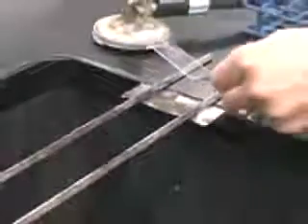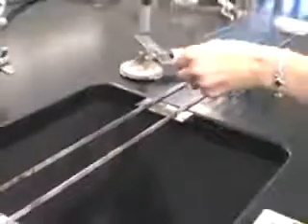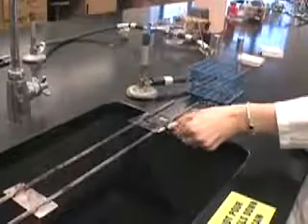Use your slide forceps and run the slide through the Bunsen burner two to three times. So now you're ready to go.